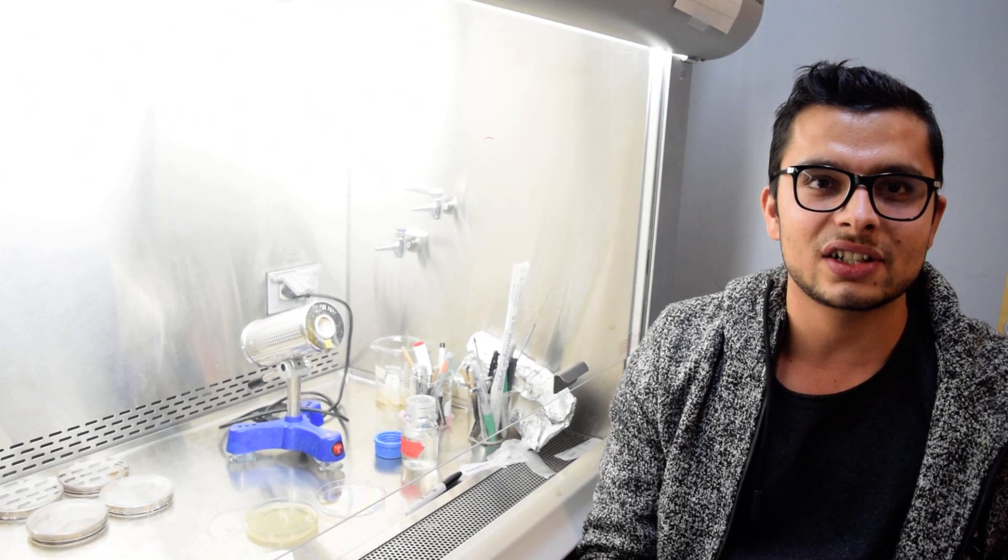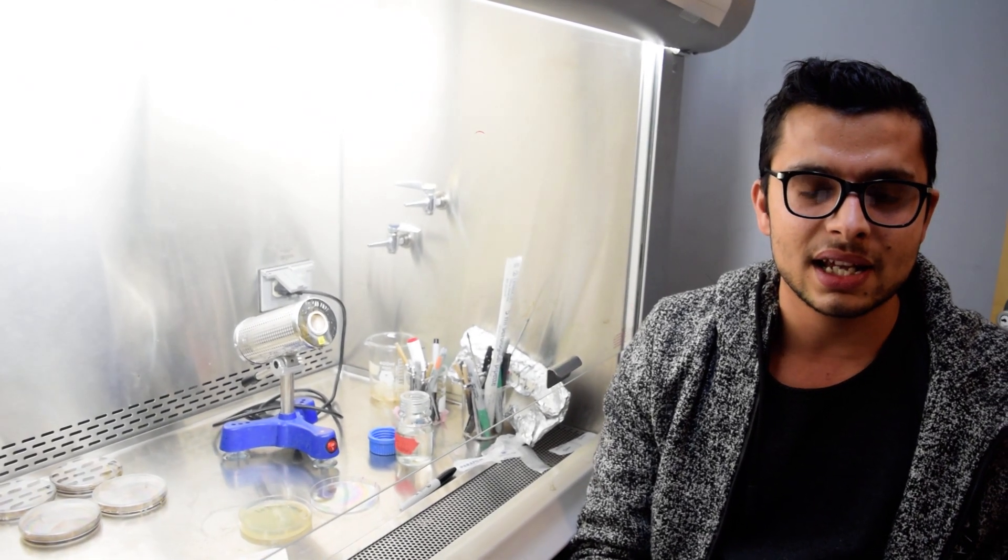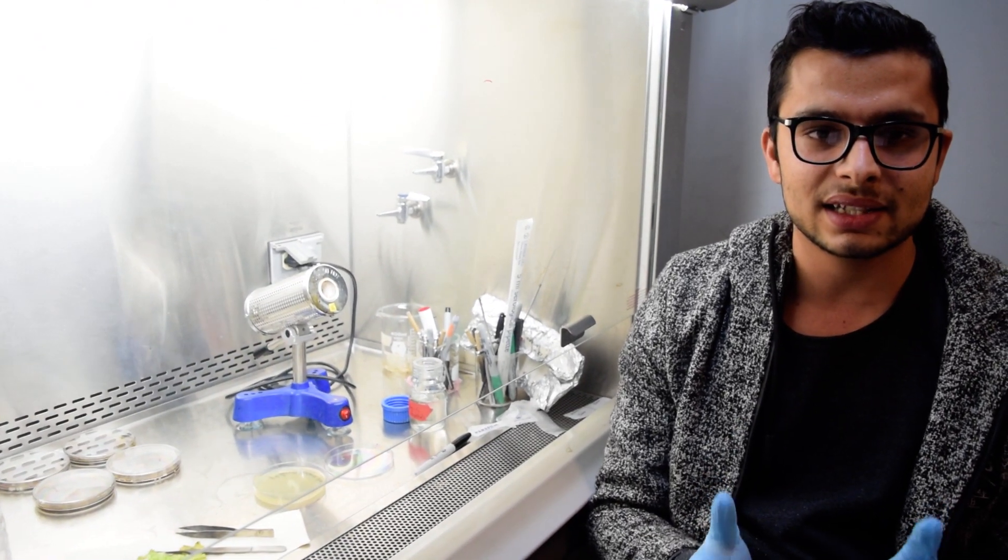Hello, I am Milan Pant, a graduate research assistant from Tennessee State University. Today we are going to learn the plating techniques in culture media.